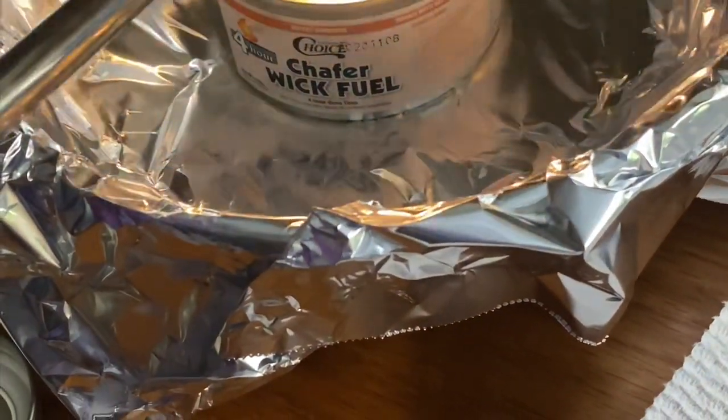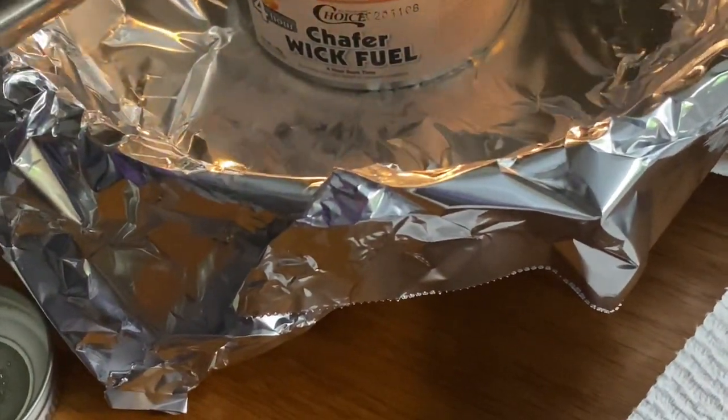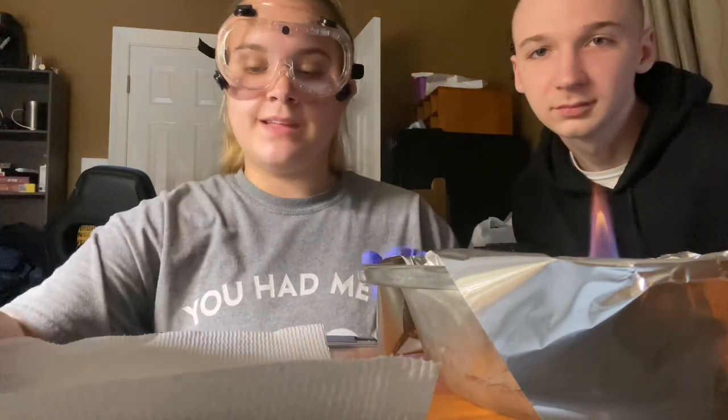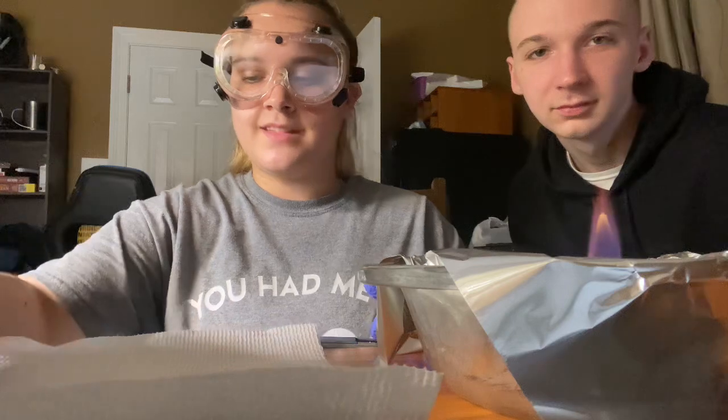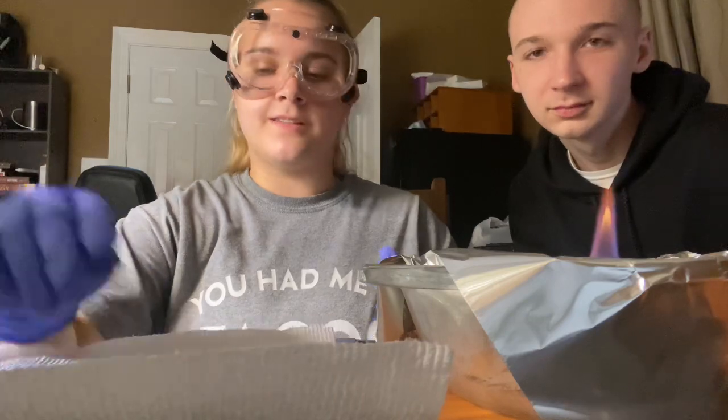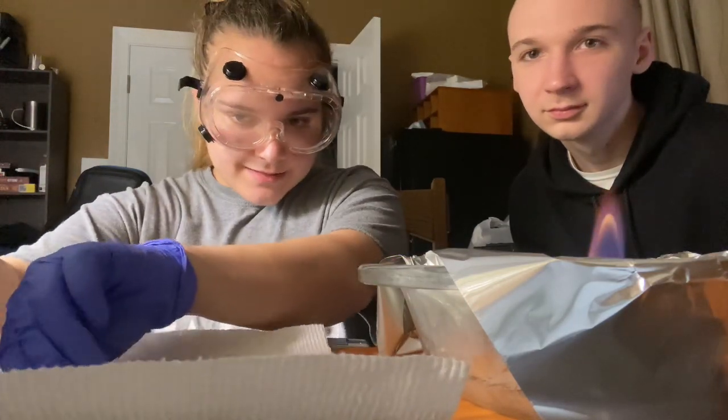Now we're moving on to exercise 2, which is the qualitative cation test, which includes the flame test in the anions, cations, and ionic reactions experiment. I put a pea-sized amount of potassium iodide onto the spatula, and I'm going to hold it next to the fire to see if there is a color change. So let's go ahead and do that.